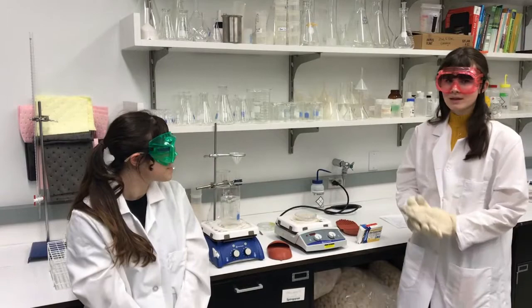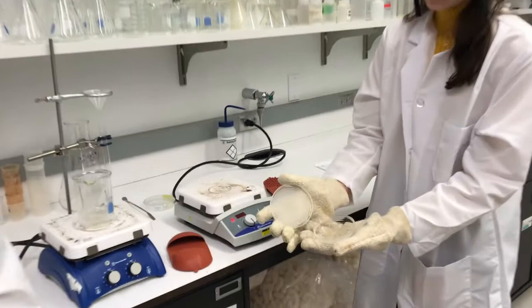The lab is written using a glass petri dish, so if you follow it as written, your results will look like this.